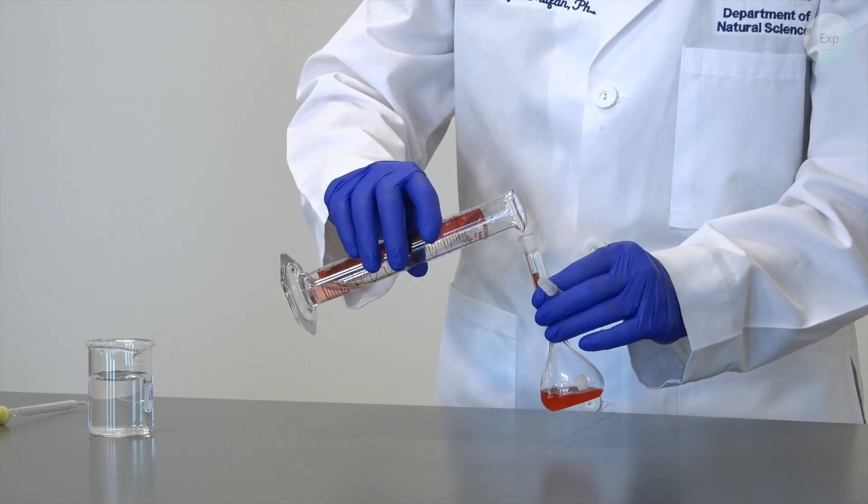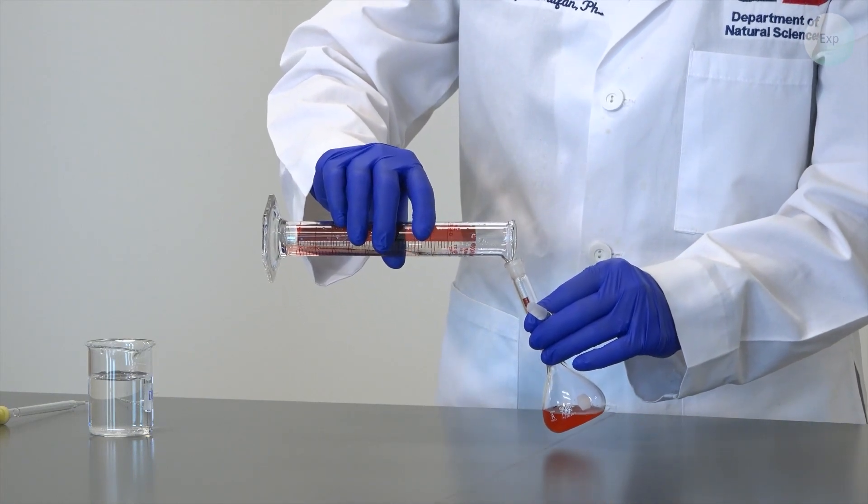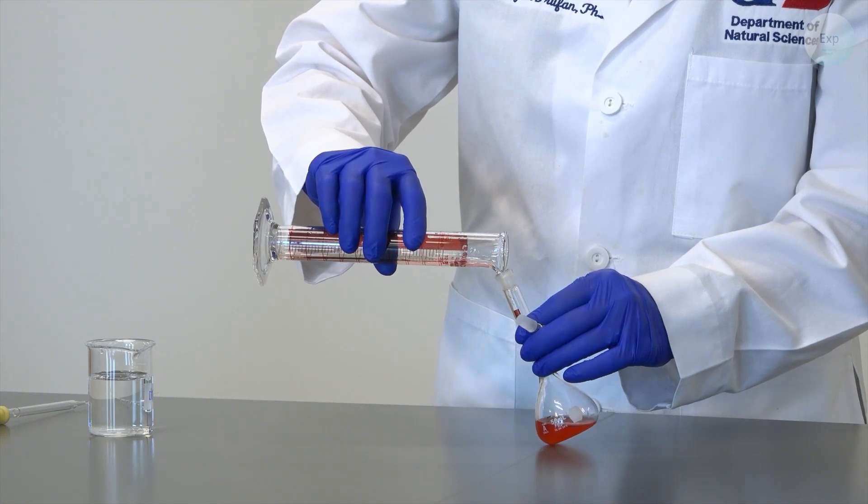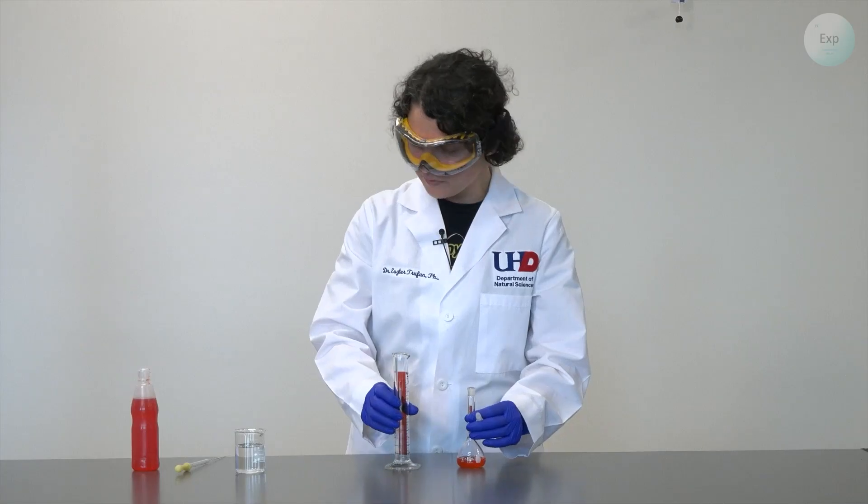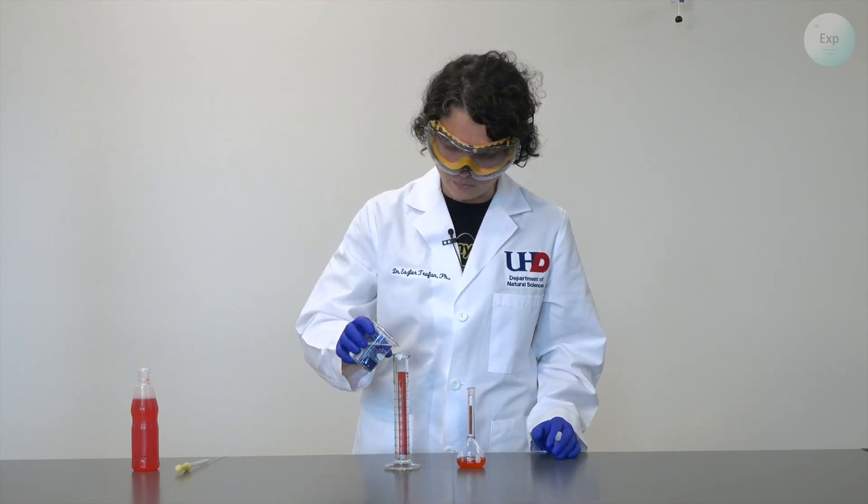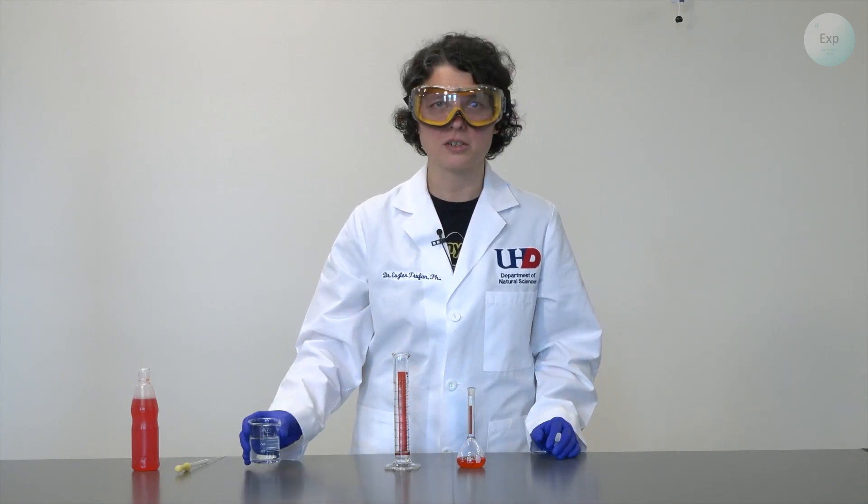We rinse the graduated cylinder and we transfer our solution carefully. It is best to rinse multiple times with smaller amounts of water than to rinse once with a larger amount.